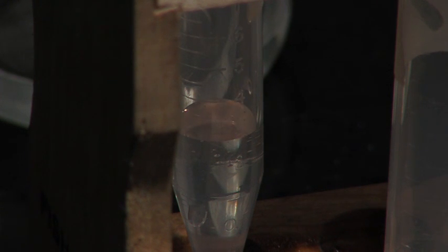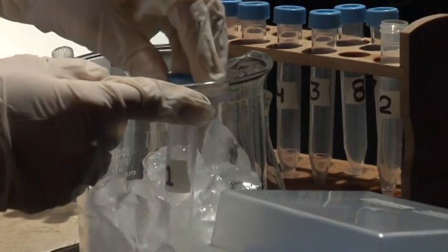Remove the spout cap and capture three milliliters in each of the first two tubes. Put them on ice.